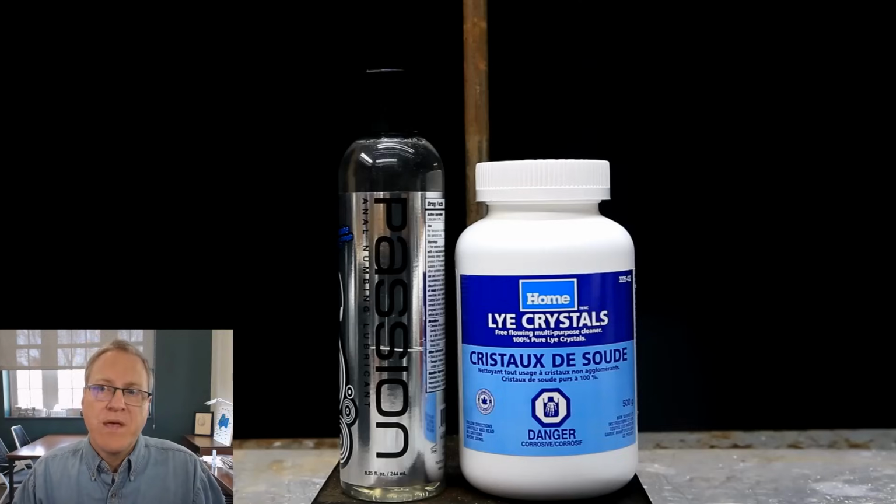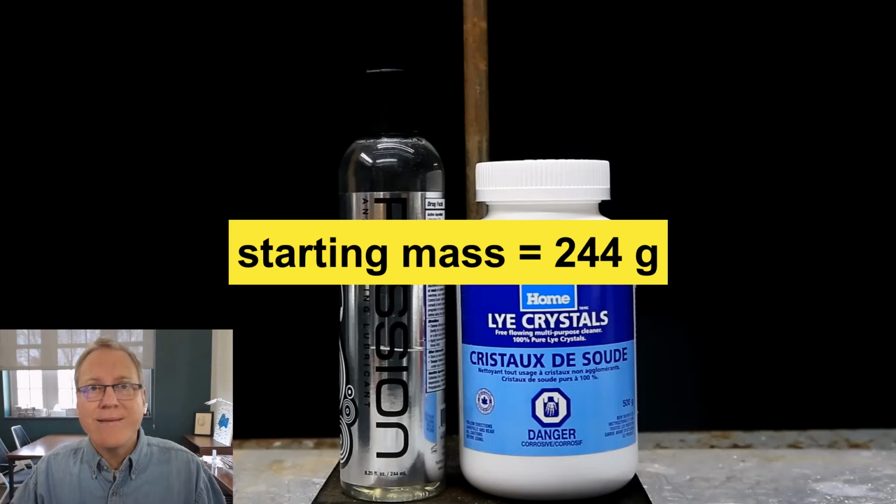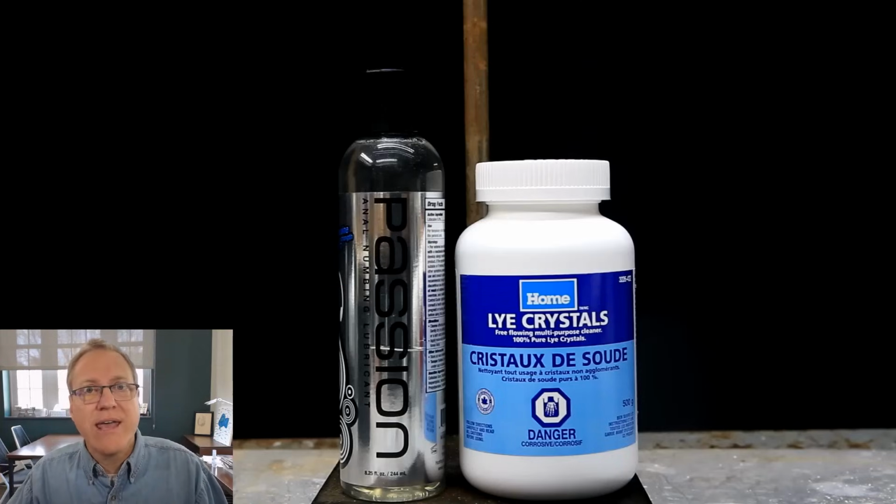This probably has a density pretty close to water, so if it has 244 milliliters, it probably weighs about 244 grams. And so that's going to give us a comparison. How much did we start with and how much lidocaine did we actually extract? And that'll just give us a sense of how efficient this process is.